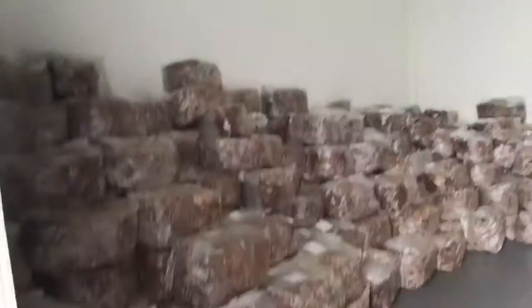So for most of the morning, we've just been loading up the lab with sterilized bags, and I'm just going to show you that real quick. So just load up the floor. The bags are still pretty hot. They've been cooling for about 24 hours in our sterilizer. They'll sit in the lab for another 24 hours, and we'll get in there tomorrow and inoculate those up.